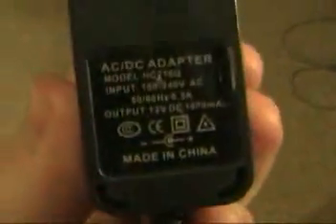The fan came with this nice extra plug which I'm going to utilize. This power supply is 12 volts DC — 12 volts direct current — and the fan is also 12 volts.